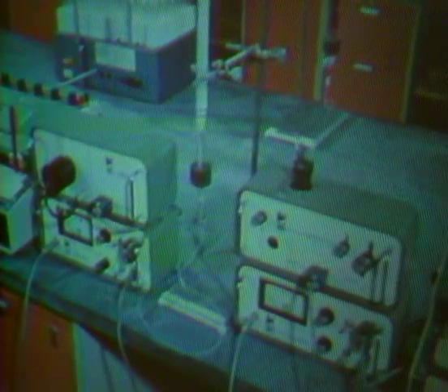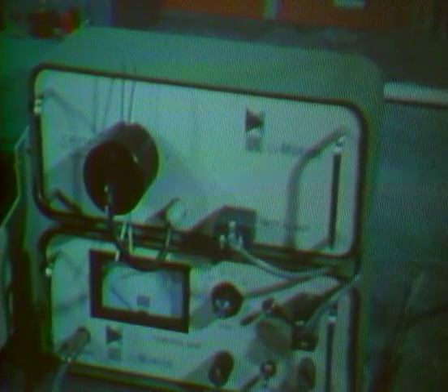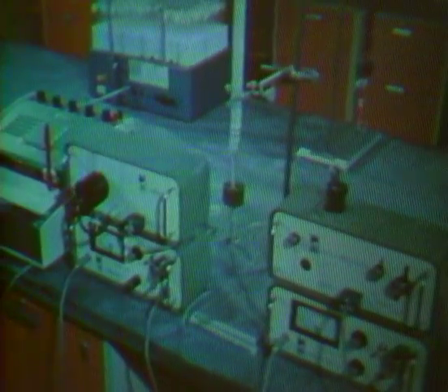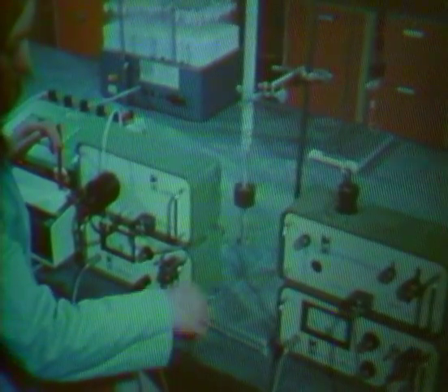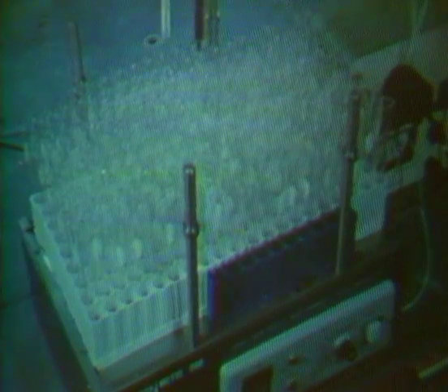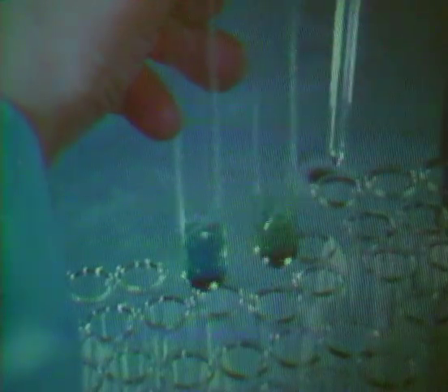Detectors commonly used in liquid chromatography are based on the measurement of ultraviolet absorption or the change in the refractive index of the column effluent. Both types are continuous measurement units and require a mobile phase of uniform composition. Thus, they cannot be used with the gradient elution technique. Automatic collection of fractions is a common technique in liquid chromatography. The fractions are collected individually for further identification or investigation by additional techniques.